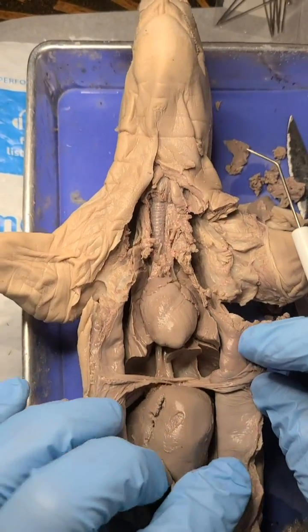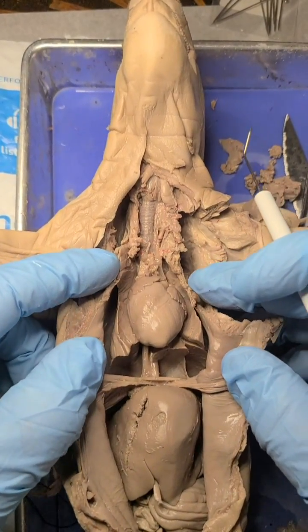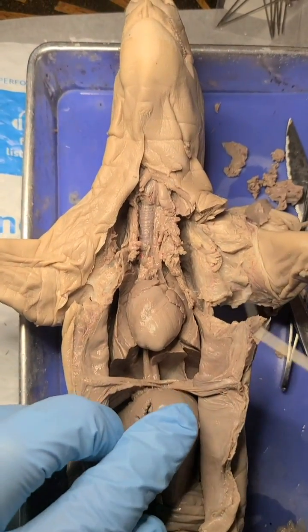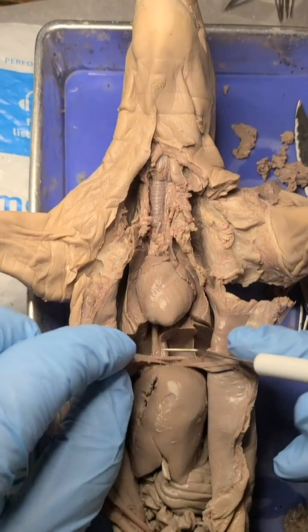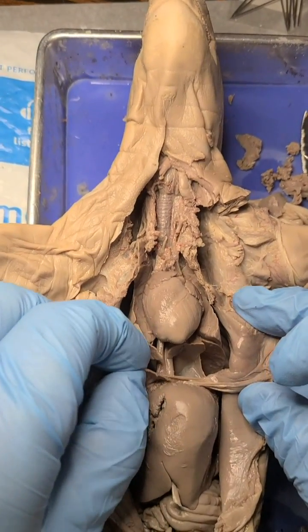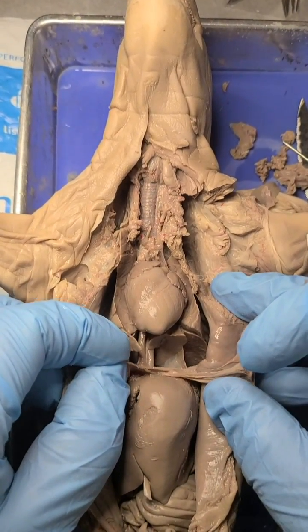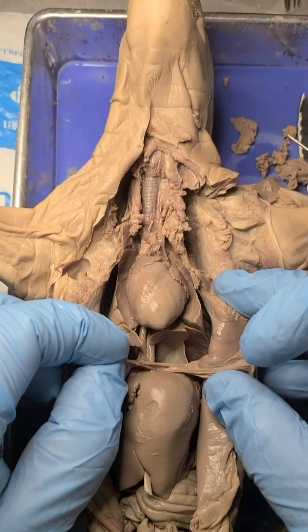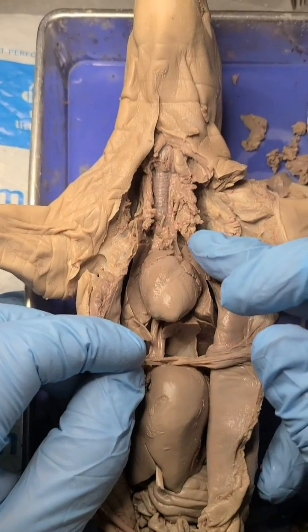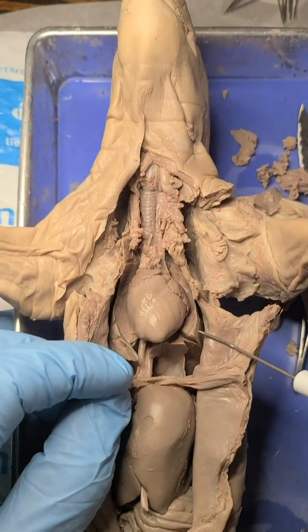When we breathe, we have muscles lining our ribs that help expand the chest cavity, but also the diaphragm. This tissue right here is a muscular tissue — that's the diaphragm. When it contracts, it increases the volume of the chest cavity, and that creates low pressure, so air gets drawn in to the lungs.